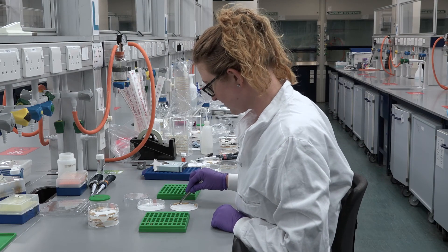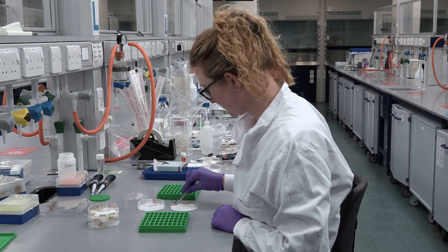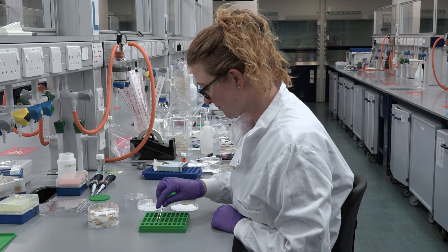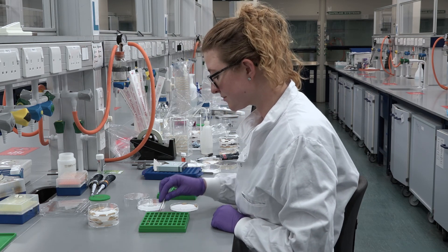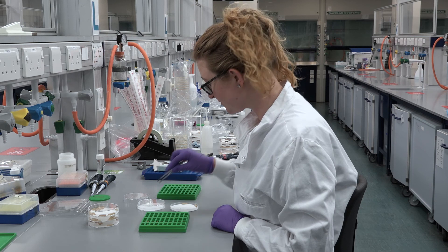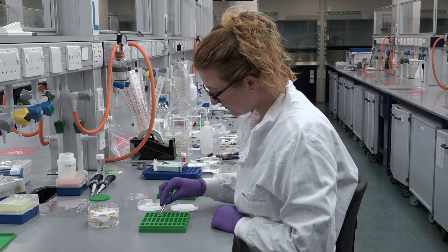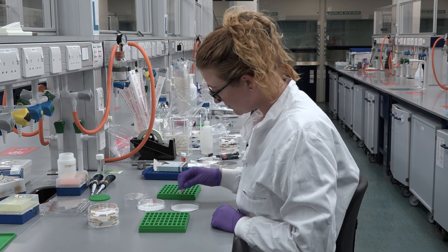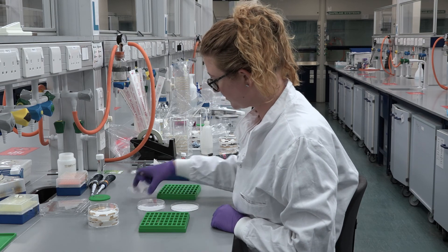For imaging larvae you will need an imager capable of taking chemiluminescence images that has the ability to have a long exposure time. We have used the BioRad ChemiDoc and the Syngene G-Box with great success.